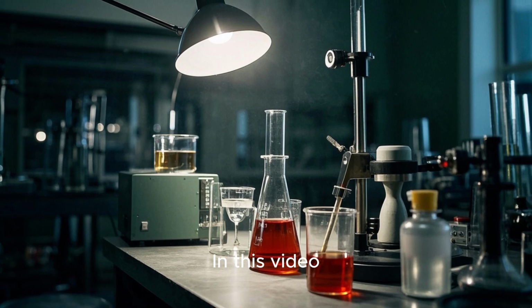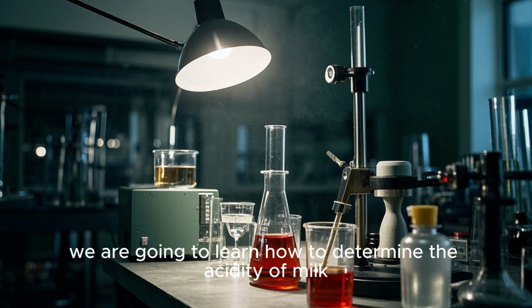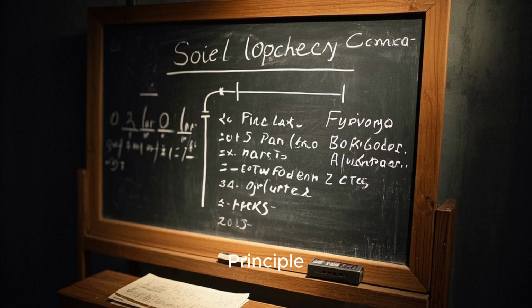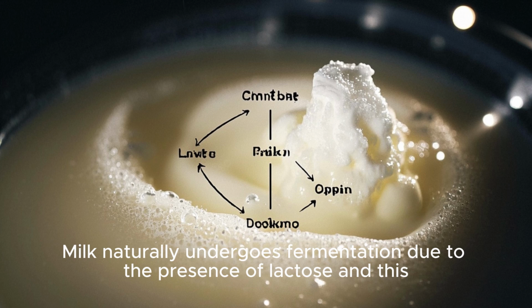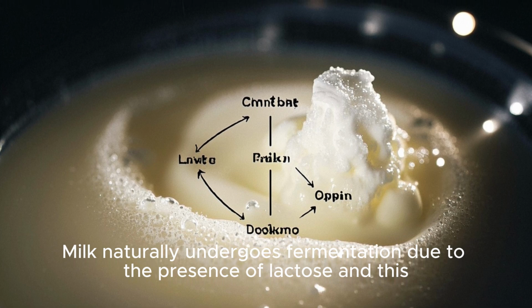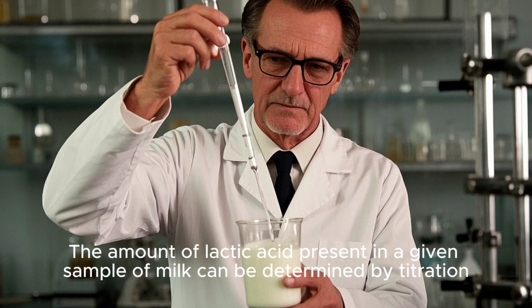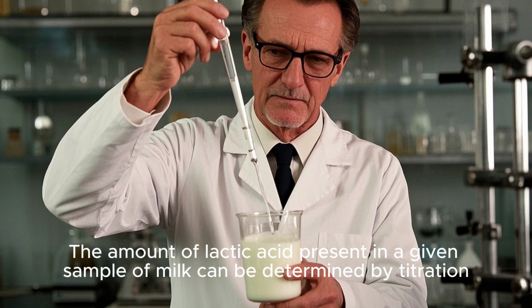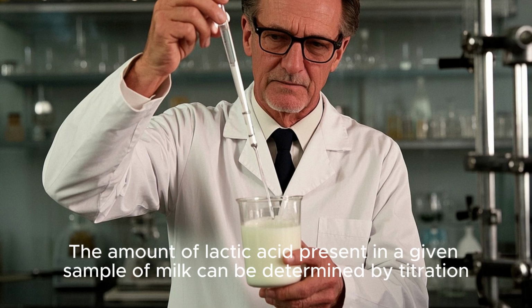In this video, we are going to learn how to determine the acidity of milk. Principle: milk naturally undergoes fermentation due to the presence of lactose, and this results in the formation of lactic acid. The amount of lactic acid present in a given sample of milk can be determined by titration.